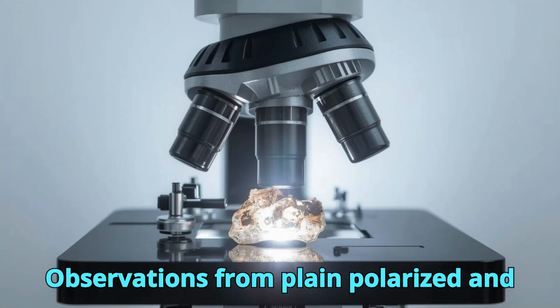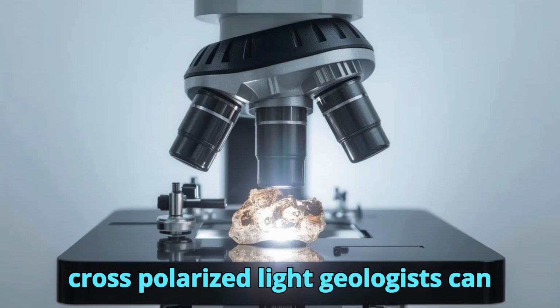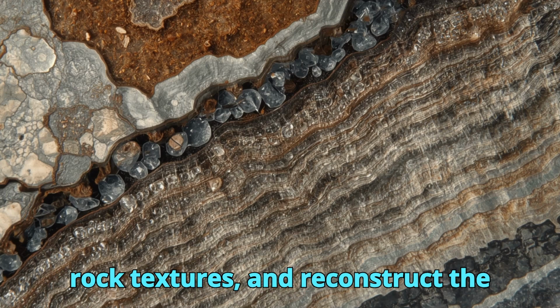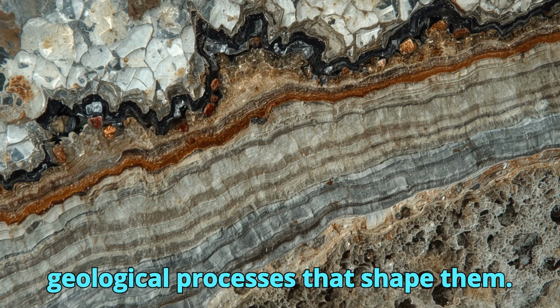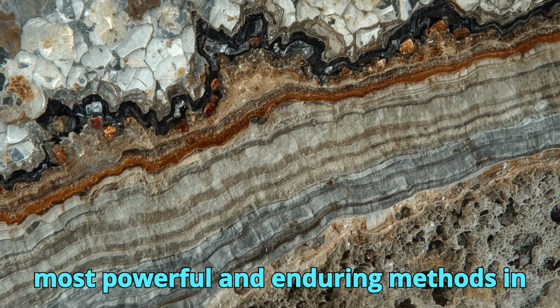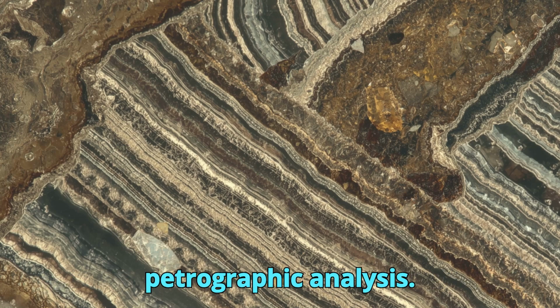By integrating observations from plane polarized and cross-polarized light, geologists can accurately identify minerals, interpret rock textures, and reconstruct the geological processes that shape them. This optical approach remains one of the most powerful and enduring methods in petrographic analysis.